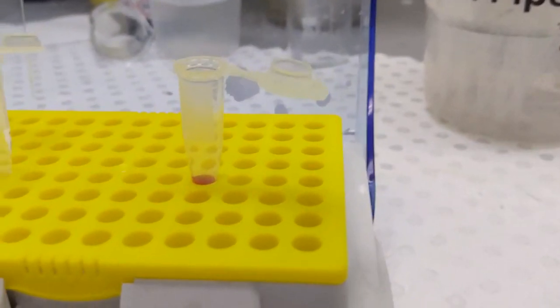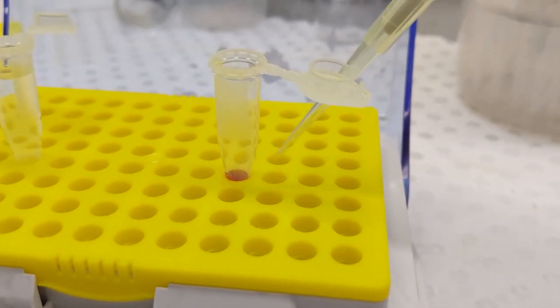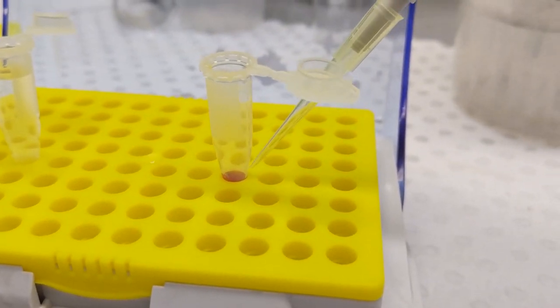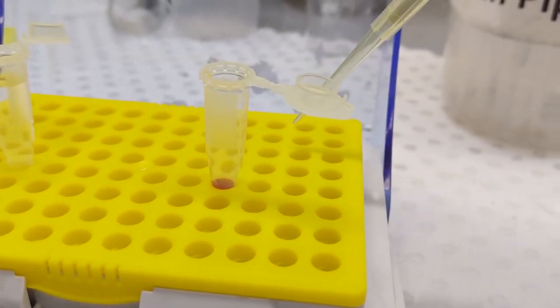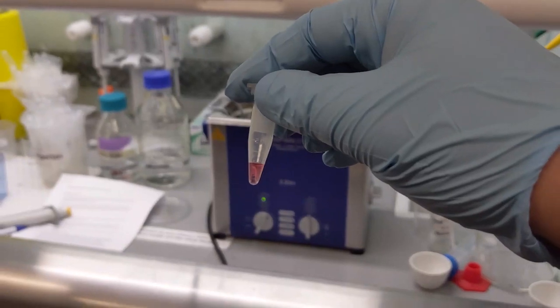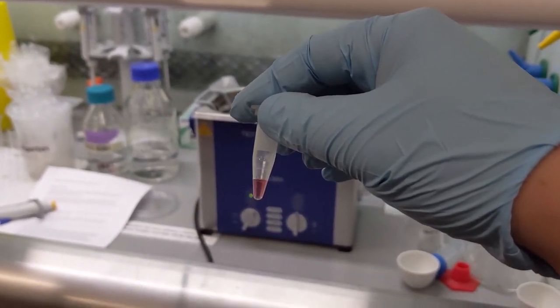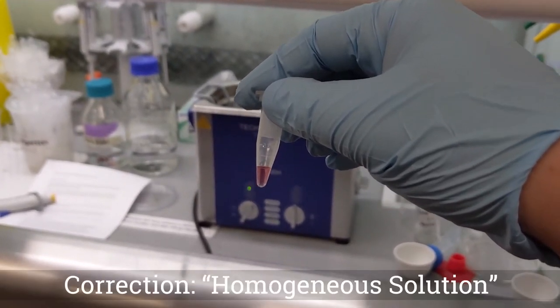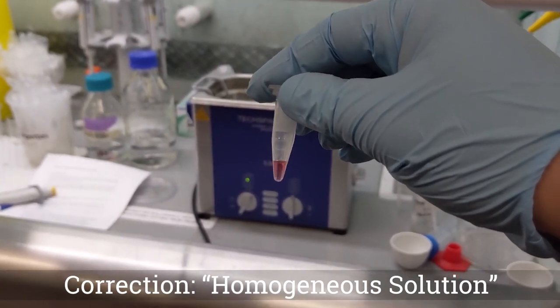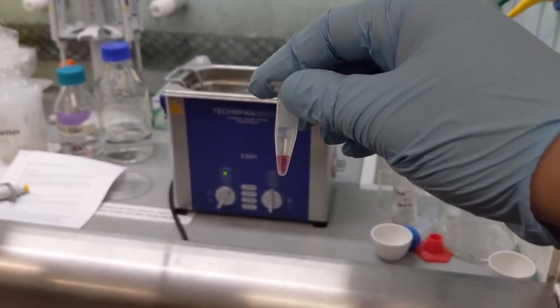You should be able to see just in the bottom there — there is the nanoparticle solution. Here we have our sample that has been diluted, and to create a homogenous solution we are going to put it in the sonicator for 15 minutes.